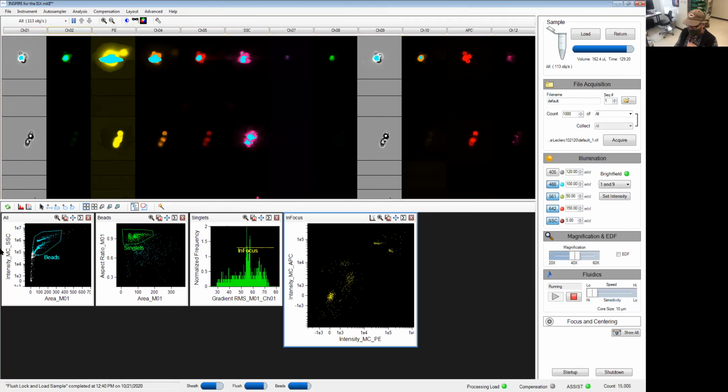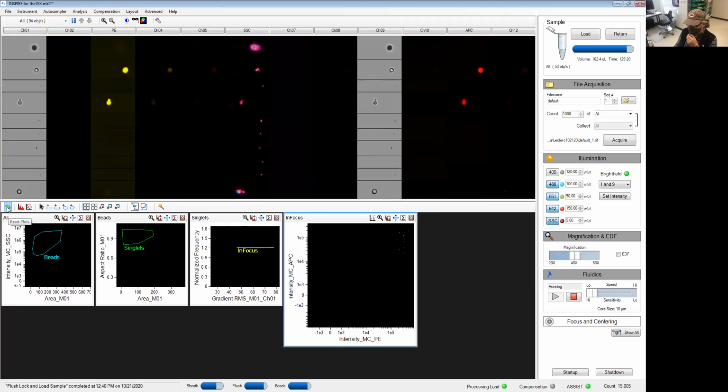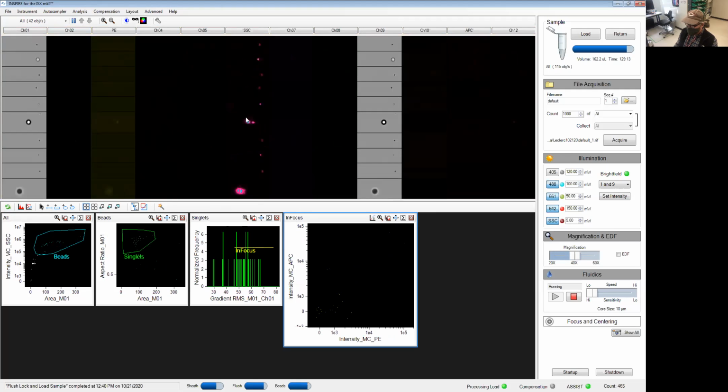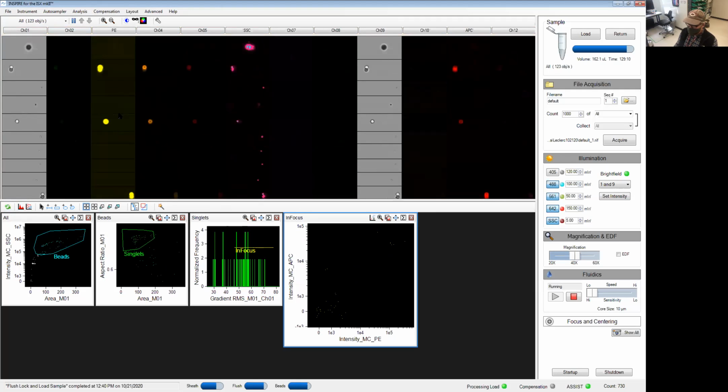See how that looks. The refresh button over here. In some cases, I still have a cyan dot. It seems PE is better.